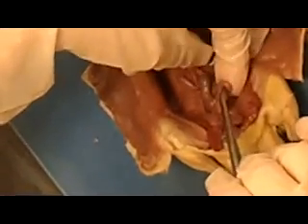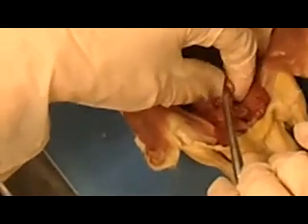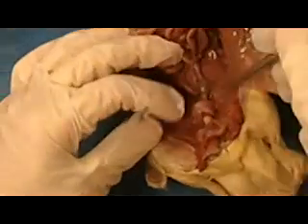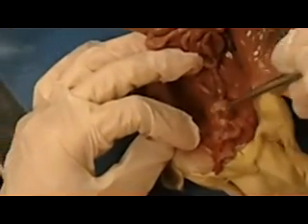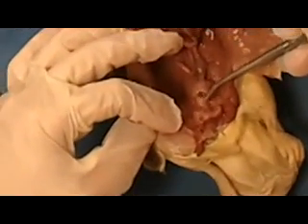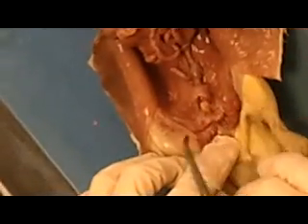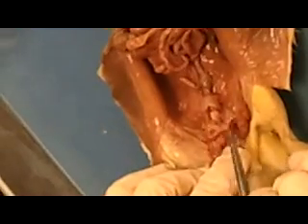I always say it looks like a snail. It's kind of swirled around and it's bumped. It's got bumps and ridges all over it. Right in front of the seminal vesicles, he would have this little piece right here. Now that is actually the urinary bladder in the male. It's going to look a little bit different than it does in the female. And then right above the urinary bladder, these swells right there are going to be the prostate gland.